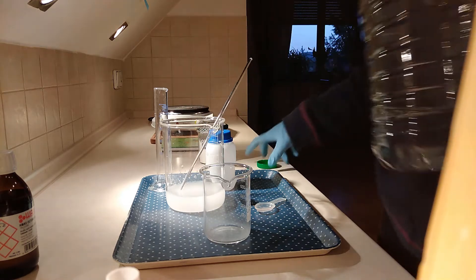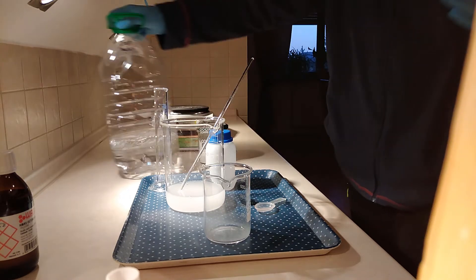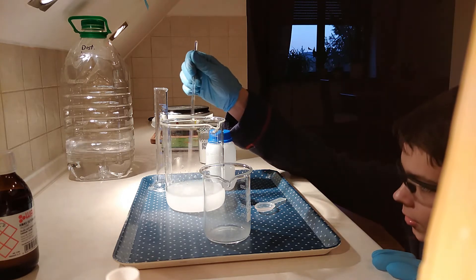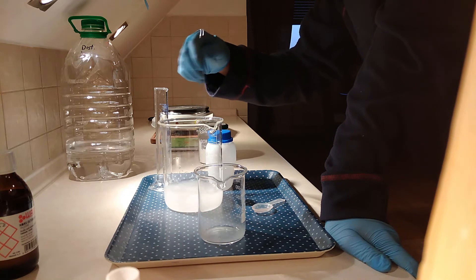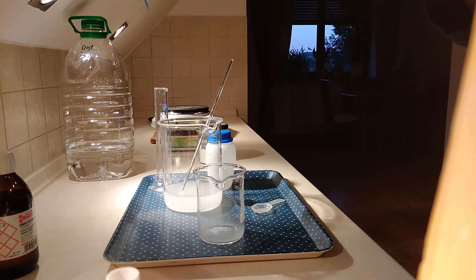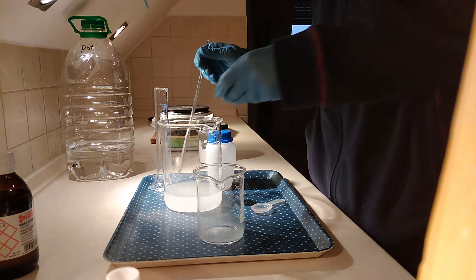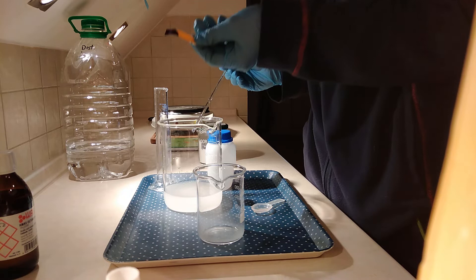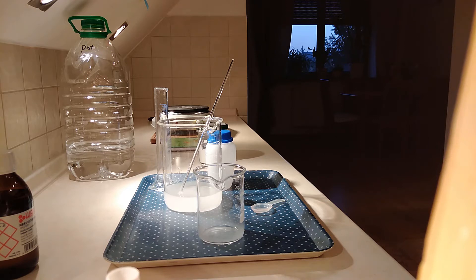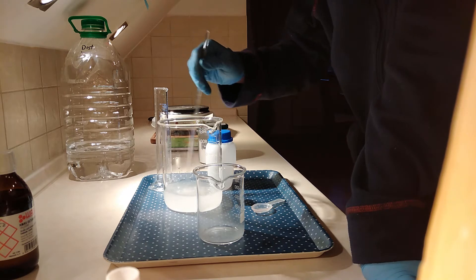I finally bought a stir rod, which is thicker and longer than the previous one I had, so it won't break that easily. All the carbonate must dissolve. I'm just gonna check how basic it is, because it has to be really basic. Yes, it's basic, as you can see — the paper turned blue, which means it's basic. Basic, alkaline — both of these terms are good.